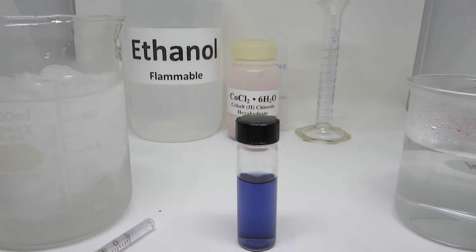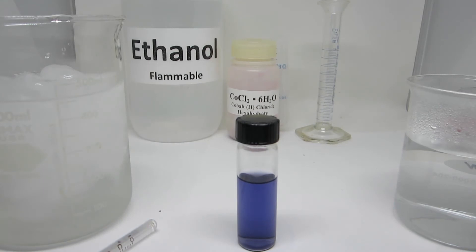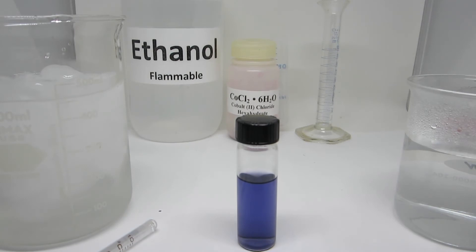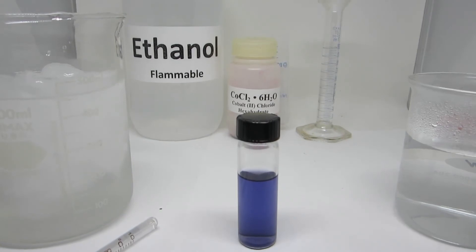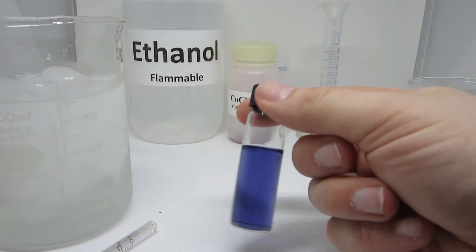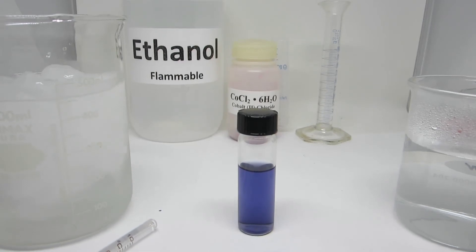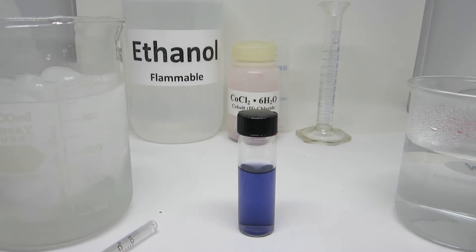You can use your unknown value to look up the concentration of each of these two components at three different temperatures: room temperature, ice temperature, and an elevated temperature. At room temperature, the solution mixture appears a purple color, a blend between the blue cobalt-tetrachloride complex and the red cobalt-hexa-aqua complex. At this temperature, they are in equilibrium to generate this color.